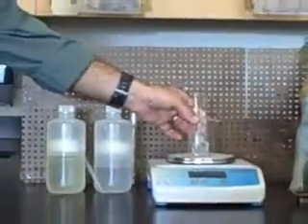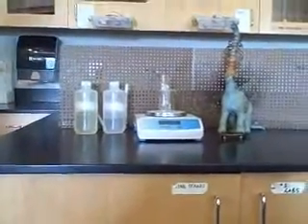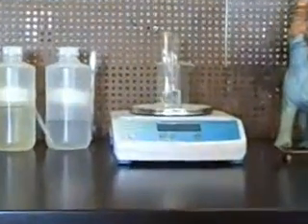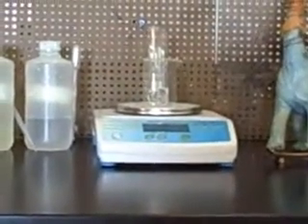We'll take the two clear liquids, put them on the balance, and our, what would we call this mass? Initial. The initial mass is 80.24 grams.